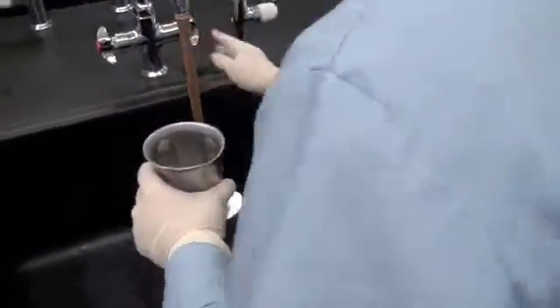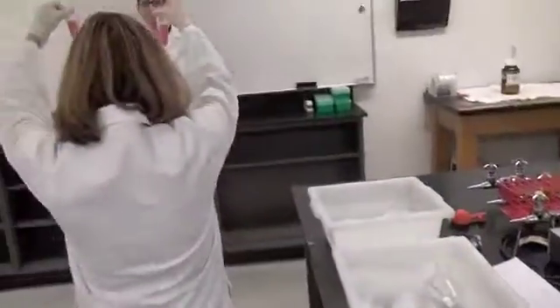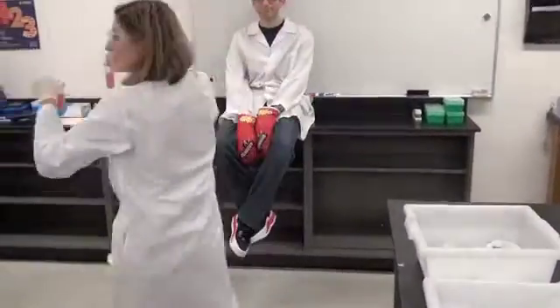Oh, isn't it just fab how Biochemist Dicer takes the time to clean up after herself? And certainly Master TA will be deducting further points from Challenger Karate's total evaluation. Just look at the mess.